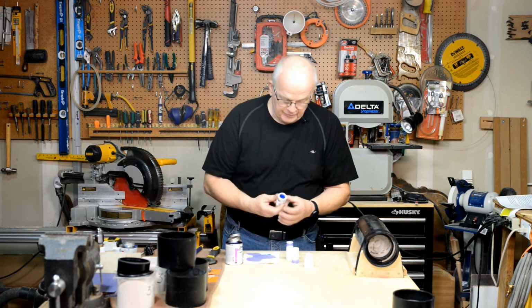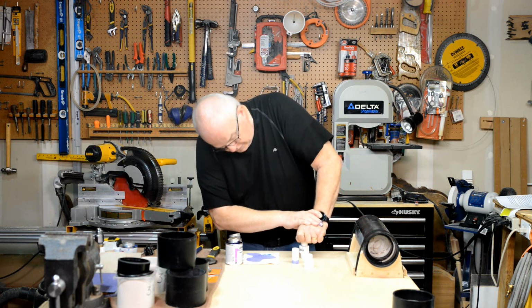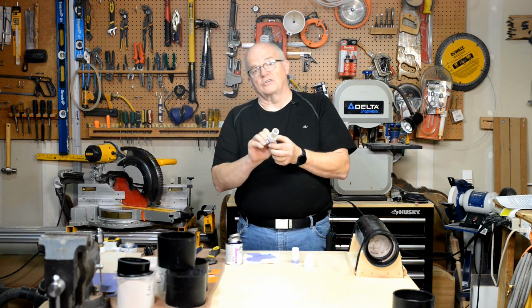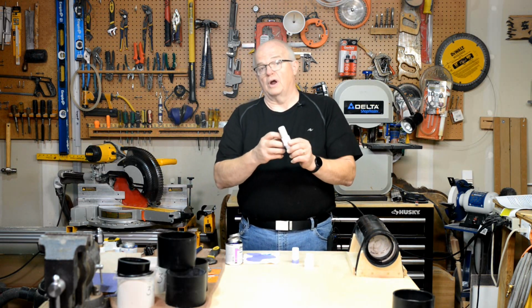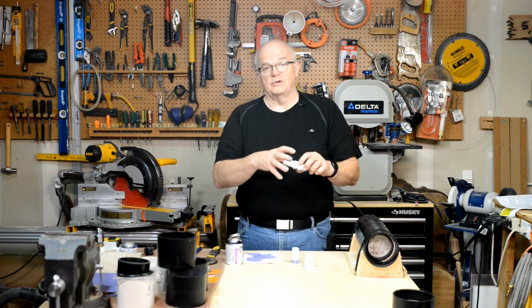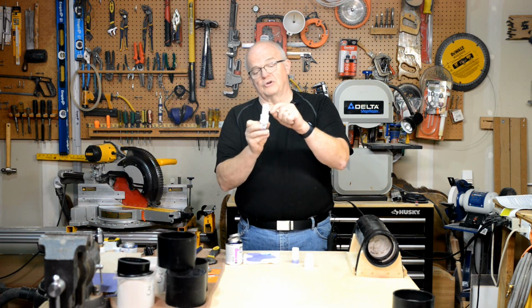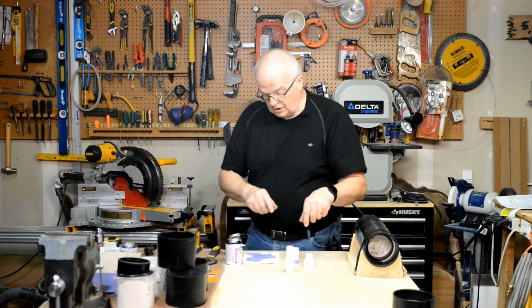Once you've done that, you can push it onto the end until it goes all the way down. Now you'll notice there's no cement around this outside edge. Normally, if you were setting up a sprinkler system or something like that, you would want it around this outside edge. But this will be sealed later on when we put the acrylic on this. That's why you only put the cement inside the adapter, so that when you push this on, it doesn't squeeze a whole bunch down here and get a lot around this outside edge. So that looks really good.